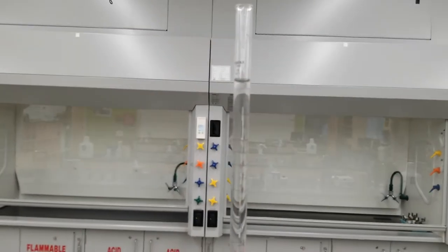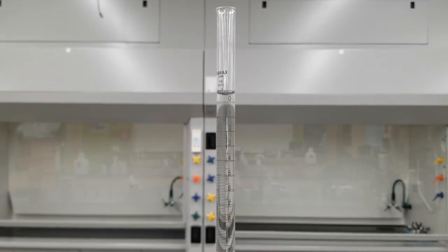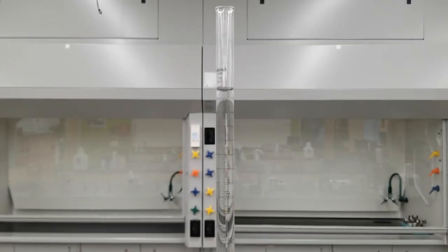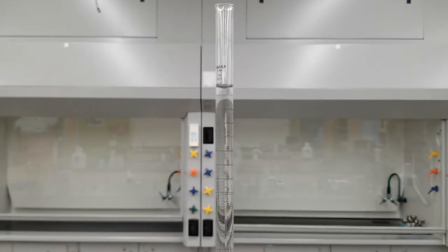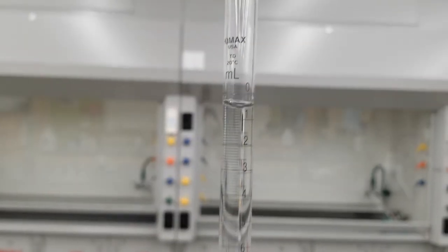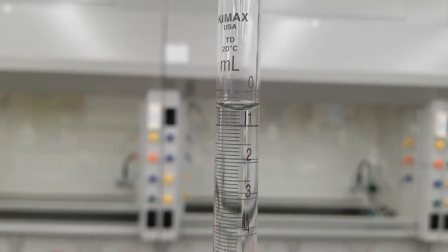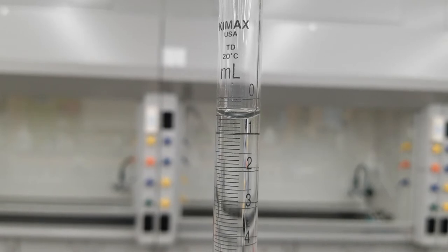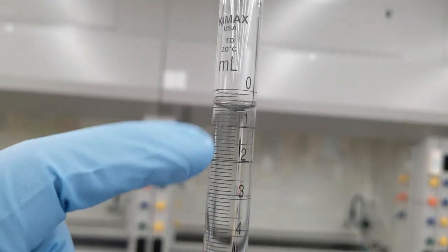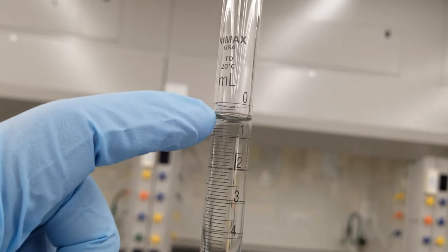Now I can see I'm still past zero, and we want to be able to read our volume — there are no volume markings past the zero point. So we need to let out sodium hydroxide past that zero marking. Some students are careful to get exactly to zero, and that makes subtraction easier, but it doesn't really matter as long as you carefully note your initial volume. I'm just going to run out some sodium hydroxide. The reading there is about 0.6 milliliters. Note that numbers increase going down your burette — each large marking is one milliliter, and each small division is 0.1 milliliters.